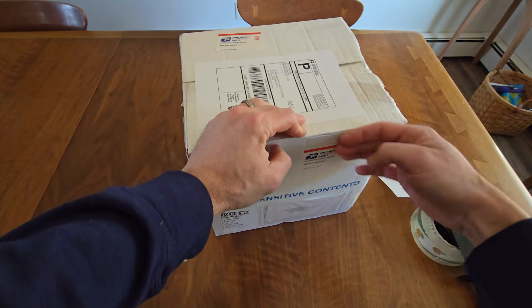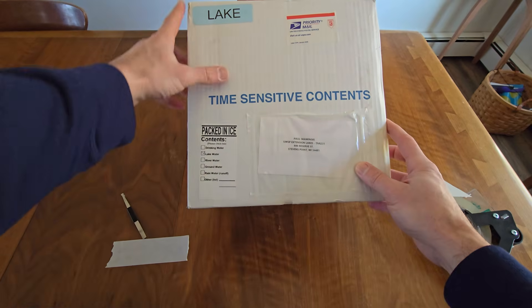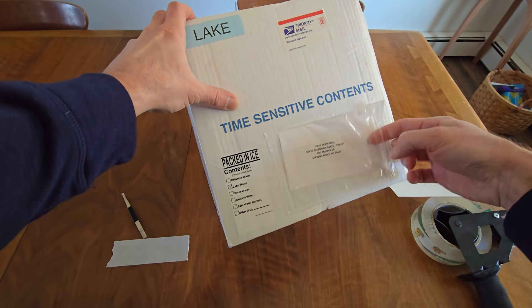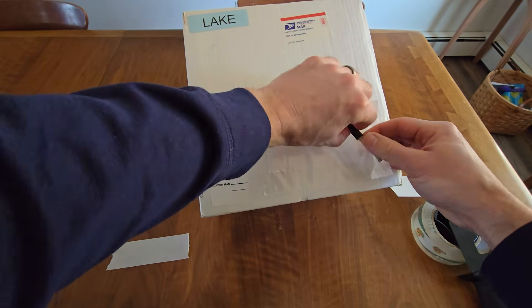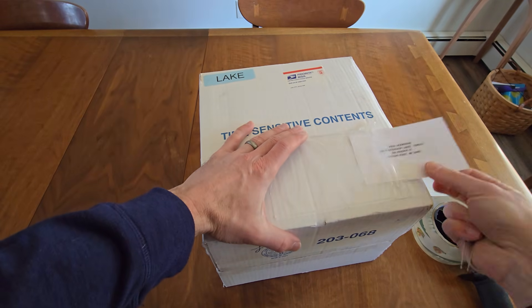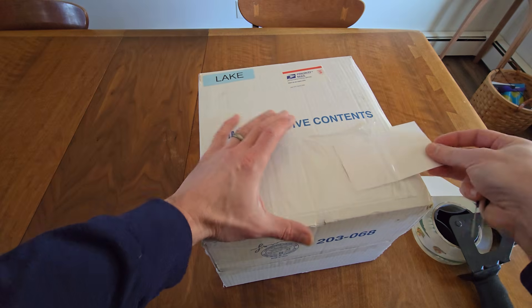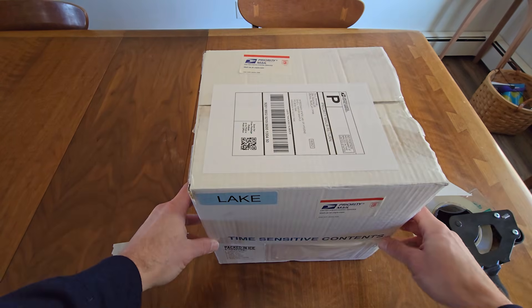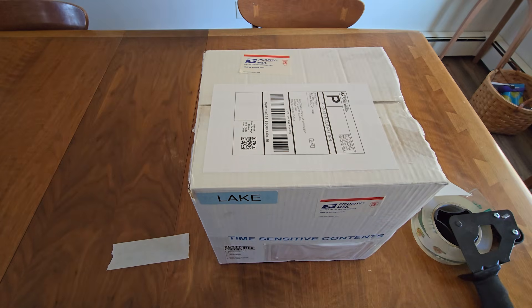The last thing to do is to flip the card around that's in the plastic envelope on the front of your box. Open up the envelope, grab your chlorophyll filter tweezers, and put the box flat on the table. Grab the card with the tweezers, flip it over, and put it back in. Re-seal the plastic envelope, stand up your box, and your package is ready to mail out.